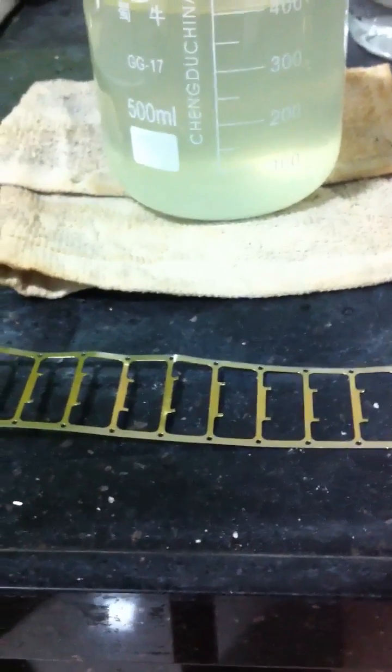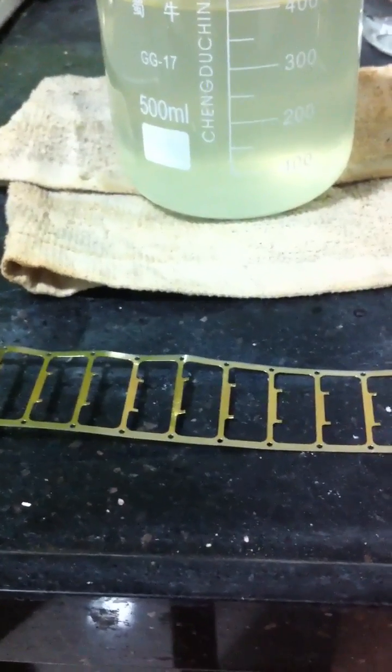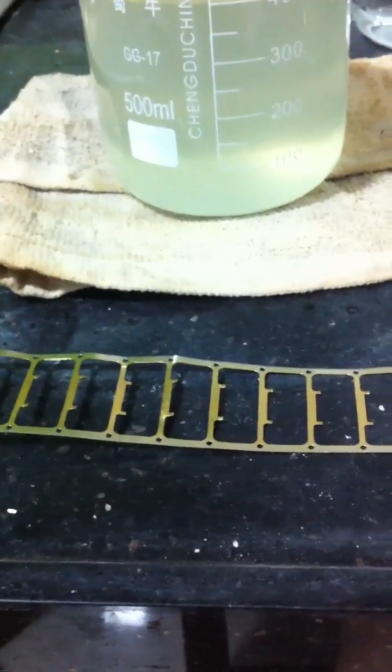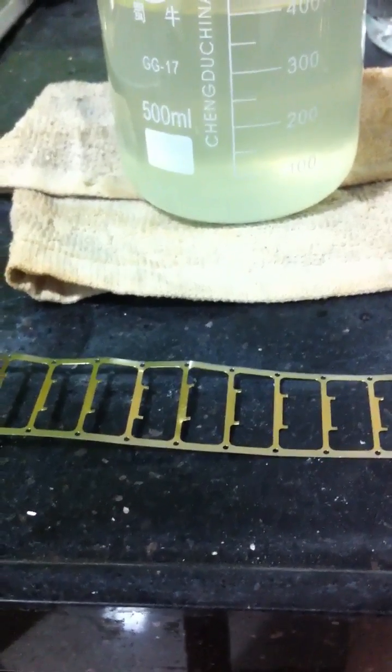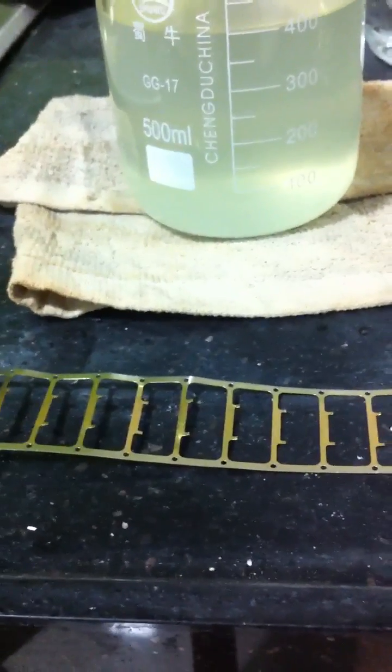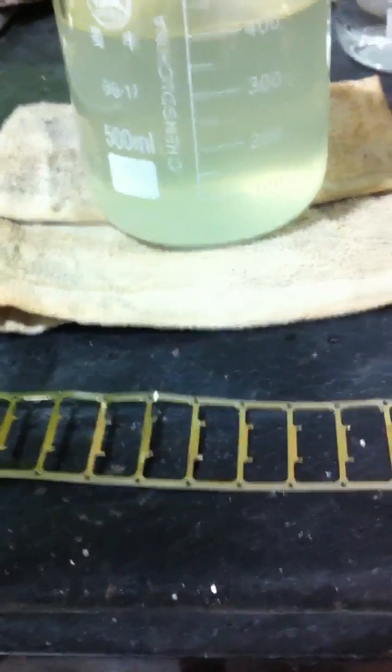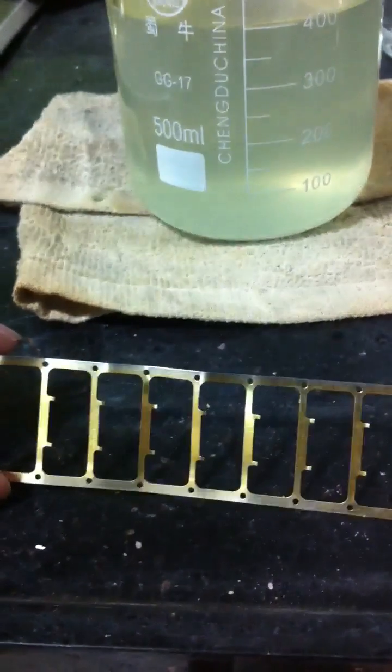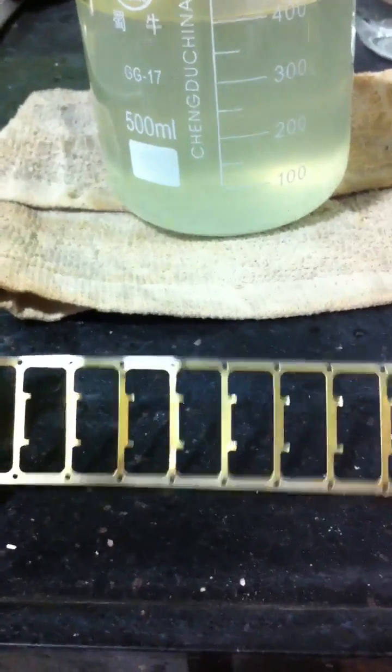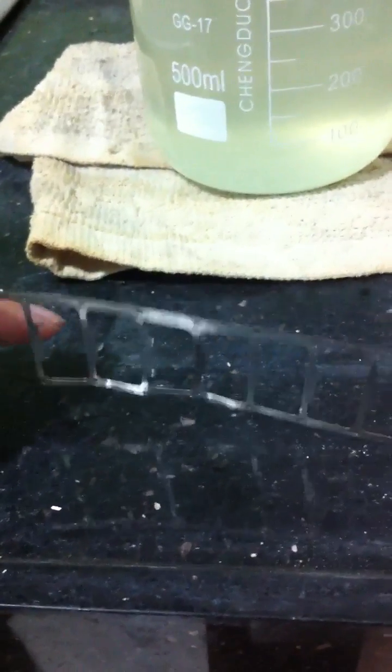Hey guys, I'm going to do an experiment about removing gold from metal pieces. This material is made by copper and covered by nickel plating, and there is gold plating on one side. The other side is not, so you can tell the difference easily by color.